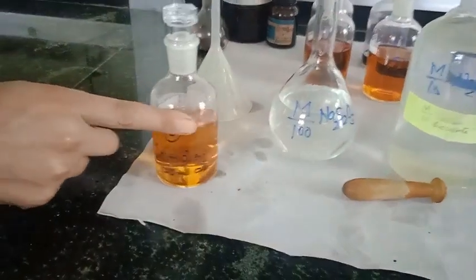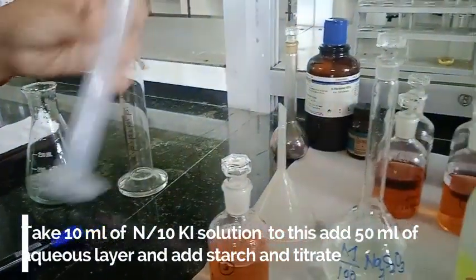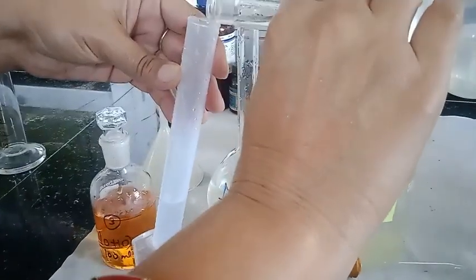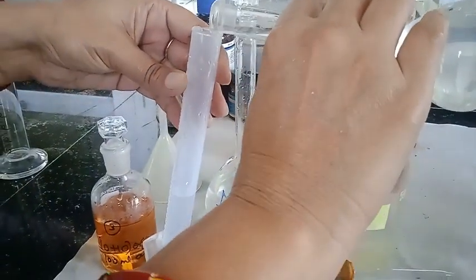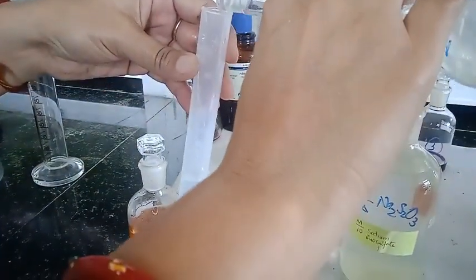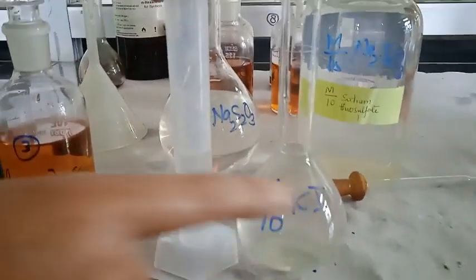So from this aqueous layer I will take 50 ml, and before that I am going to take 10 ml of KI solution which we prepared. So here I am going to rinse, and now I am going to take 10 ml of potassium iodide solution, N/10. I will first transfer it into the conical flask: 10 ml of N/10 KI solution.